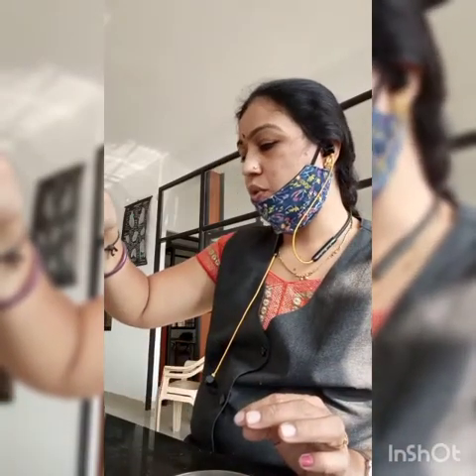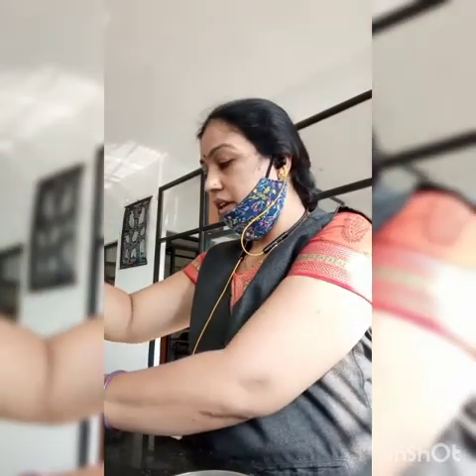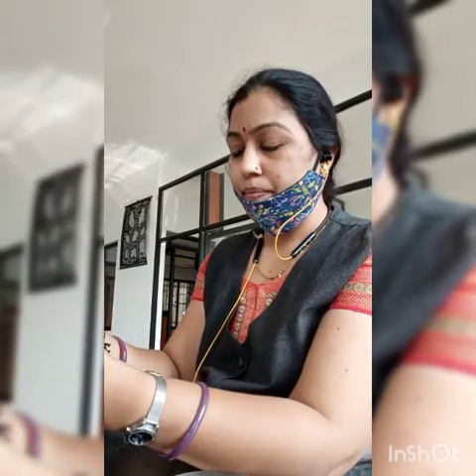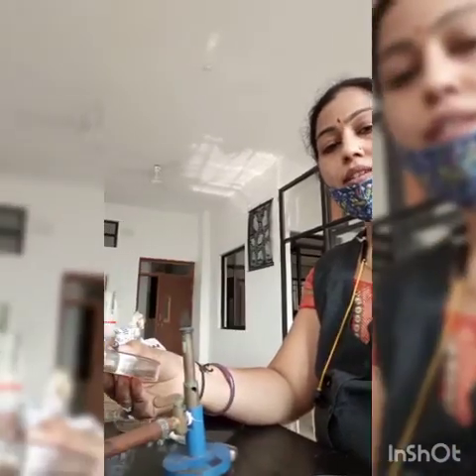Again I will show you the one colony. So I will take the purple color colony on the agar plate and wait for cooling. It is not seen. See here.